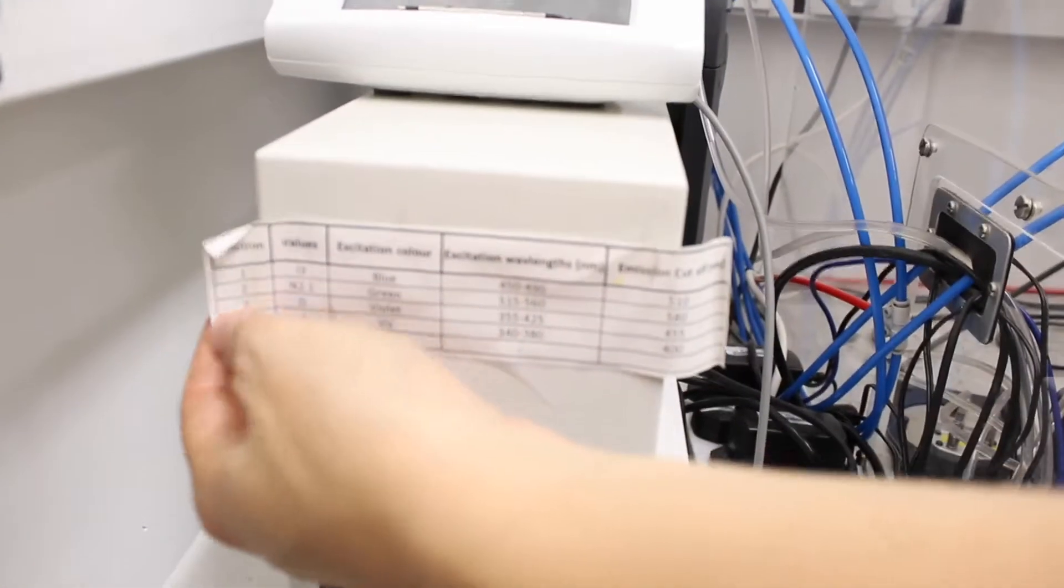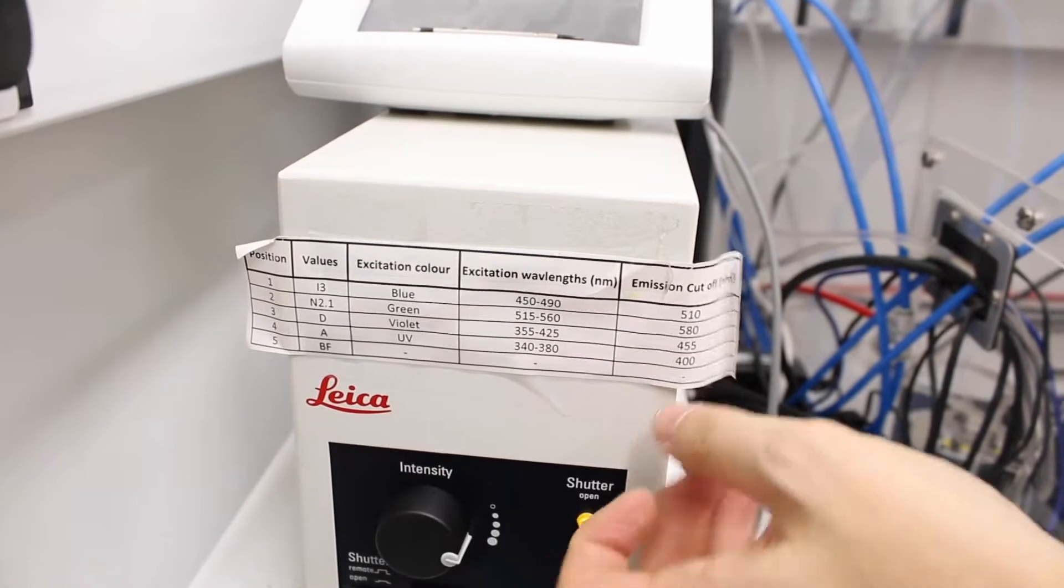So these are written on here, these positions: 1, 2, 3, 4, 5, the excitation wavelength and emission cutoff.